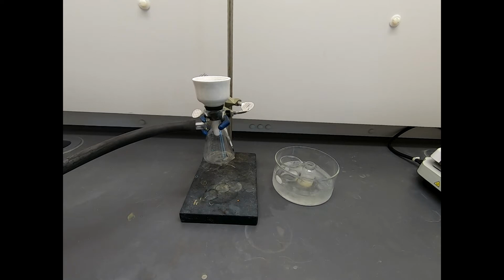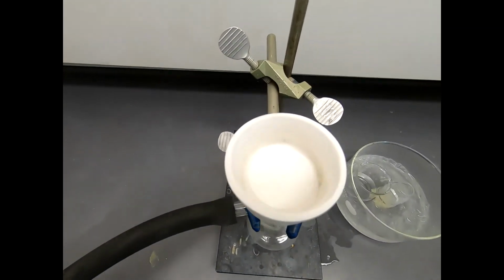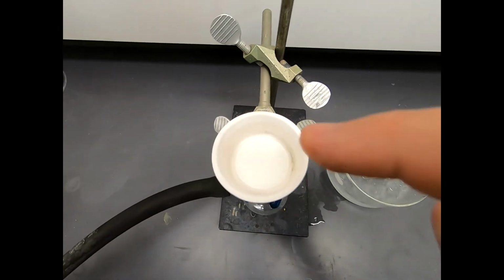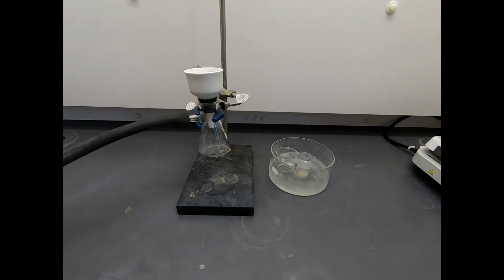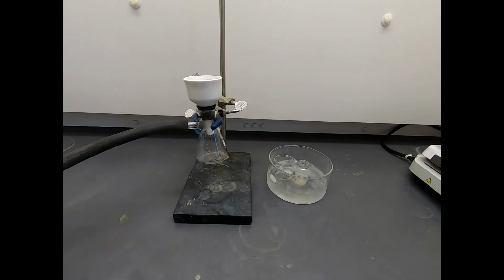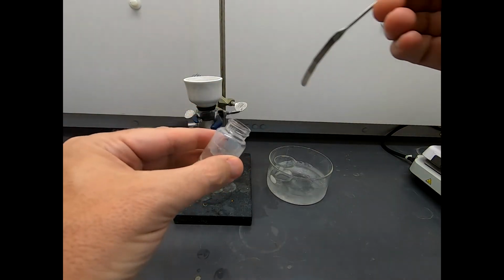In case anything is slightly soluble, we will minimize any dissolving. You can't avoid a little extra loss because of solubility, but we just want to minimize that by keeping things cold. So I'm going to go ahead and turn on our trap and vacuum. And let's take a peek down inside this funnel and just see, yes, the filter paper covers up all the holes. It's important, otherwise when you try to filter, you're just going to suck your solid right through your funnel.